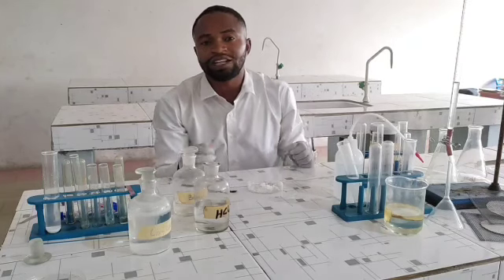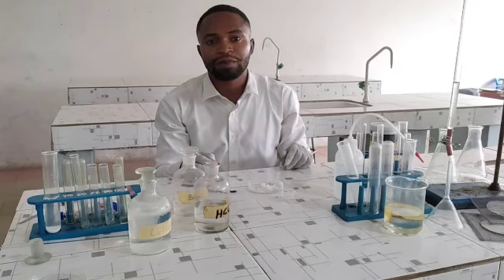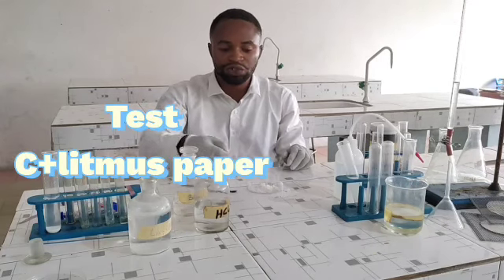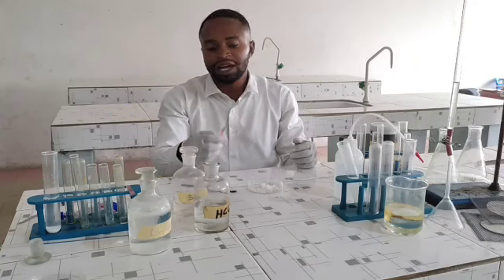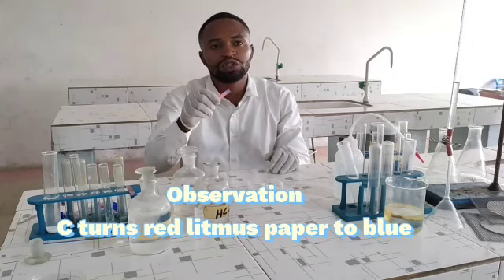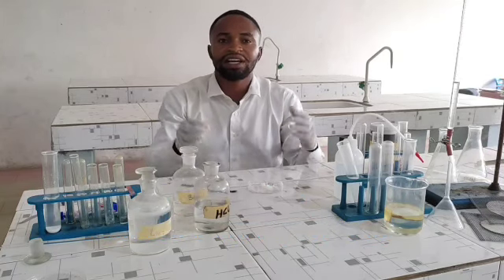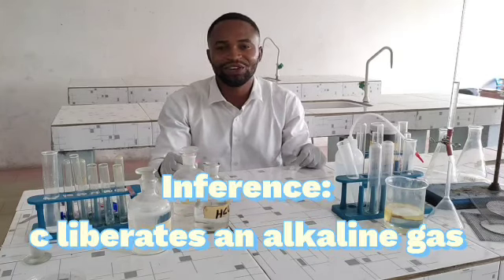So, the very first question the examiner is going to ask you is to take a litmus paper closer to sample C, and what will be your observation? Sample C turns red litmus paper blue. What is your inference or conclusion? C liberates an alkaline gas. You say you are done with this question.